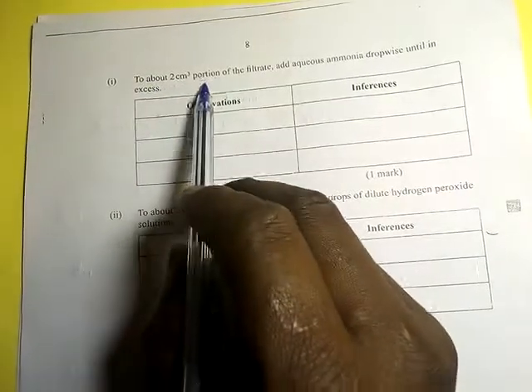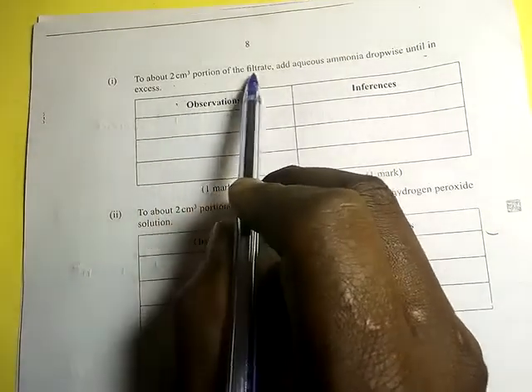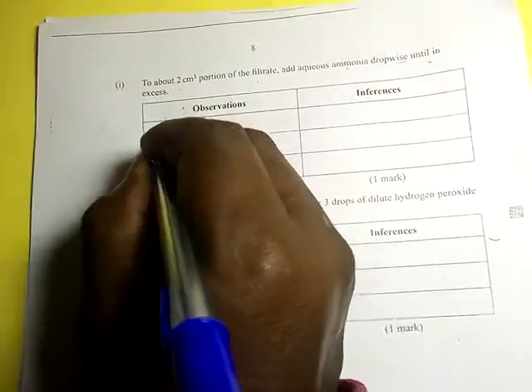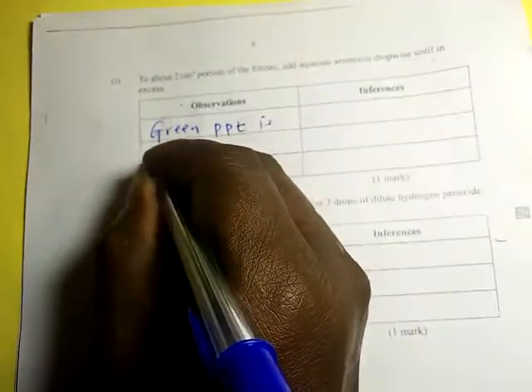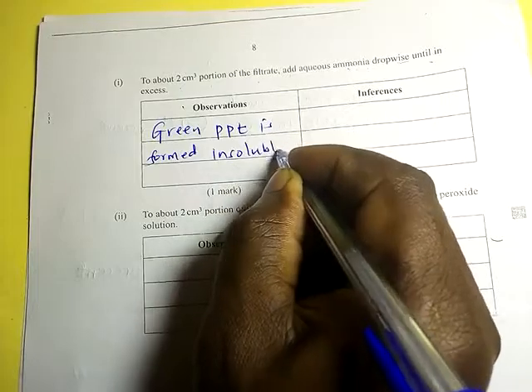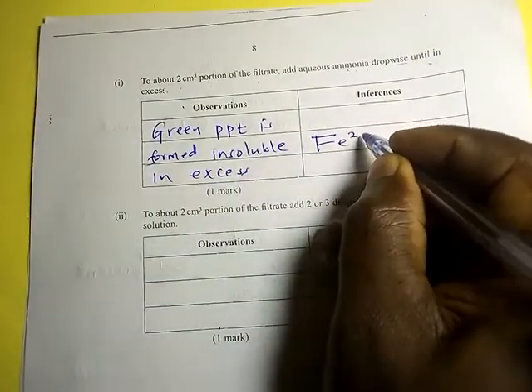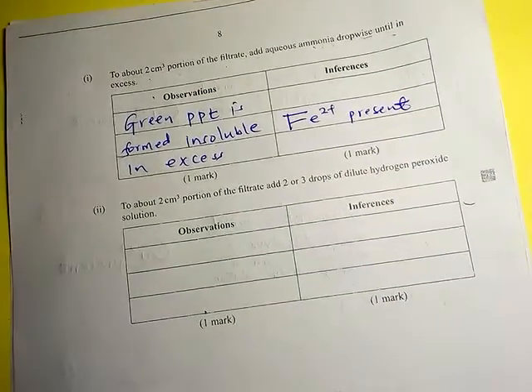To about 2 cm³ portion of the filtrate, add aqueous ammonia dropwise until in excess. The observation is that a green PPT is formed which is insoluble in excess. That tells you iron two ions are present.